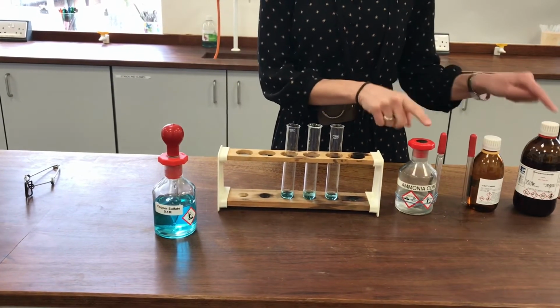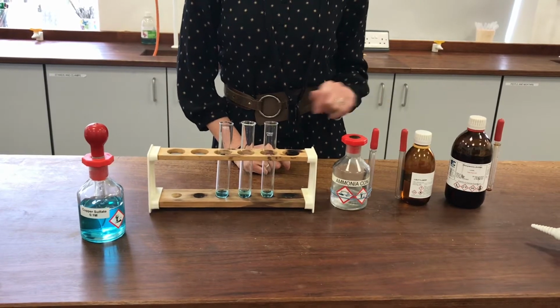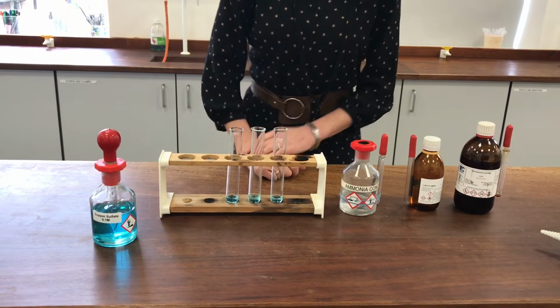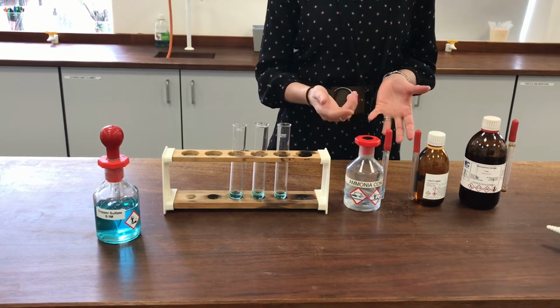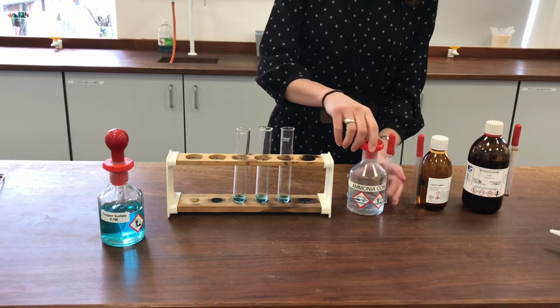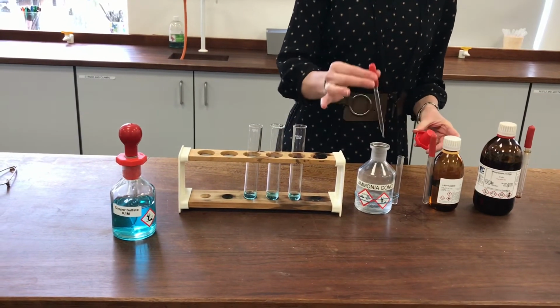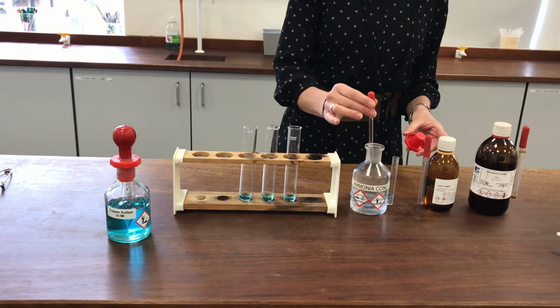So these amines obviously have NH2 groups on them, and we know that the nitrogen on the amine will have a lone pair of electrons on it. So there's capability or potential for these species to act as ligands rather than the water. And what we're hoping is that we'll see what happens when these things exchange as a ligand for water, and we'll see if there's a different colour to it.